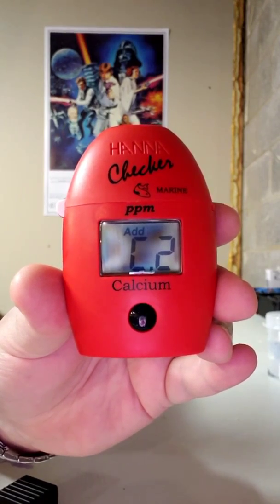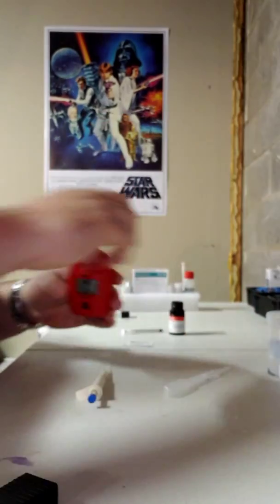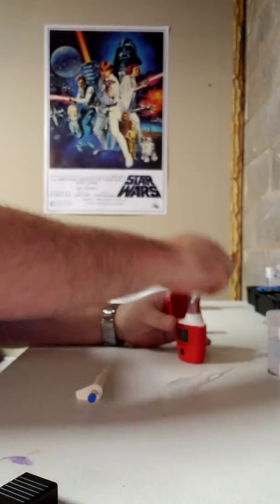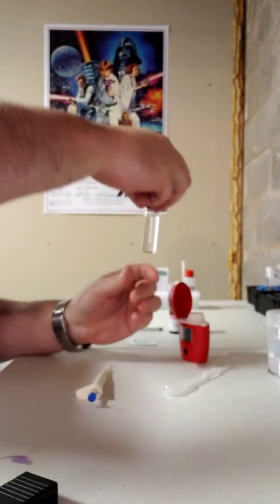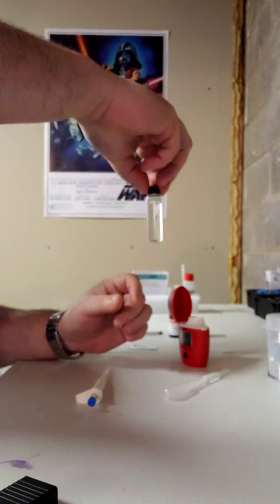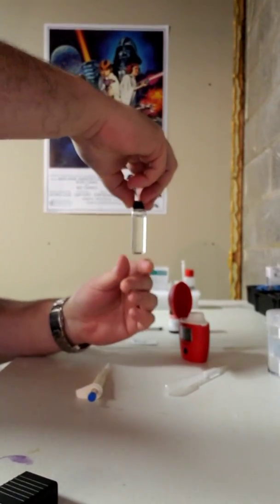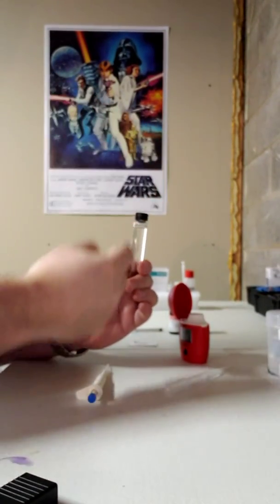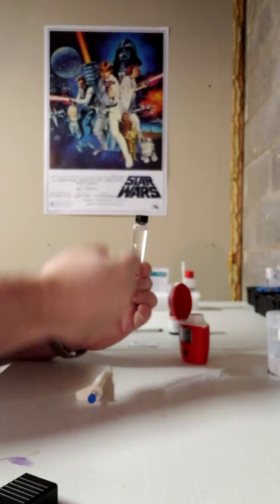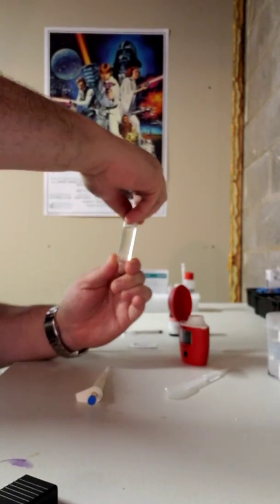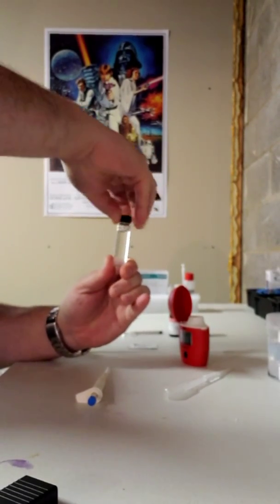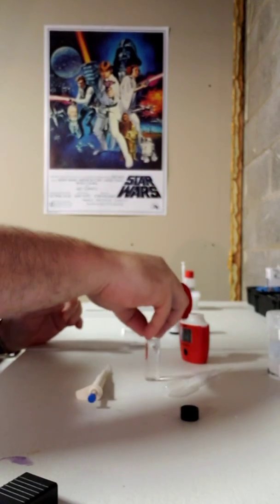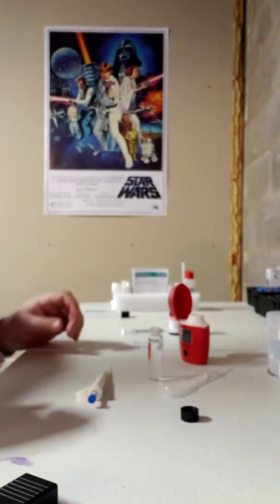Okay, C2. So now we're going to remove this. I can touch the lid and I can touch the very bottom because the reading is in the middle here. So I'm not worried about that. Take my lid off, place it back down.